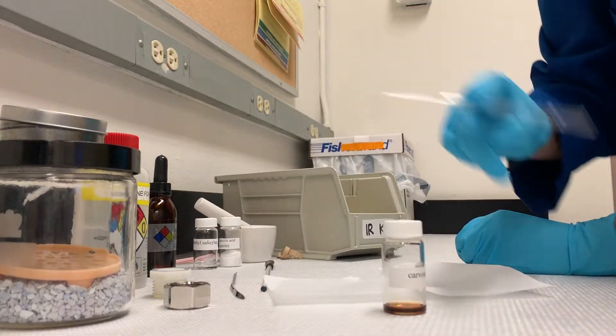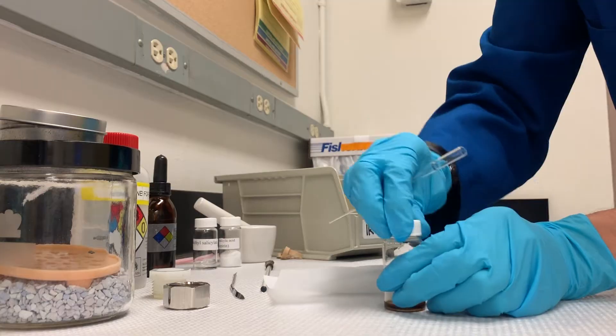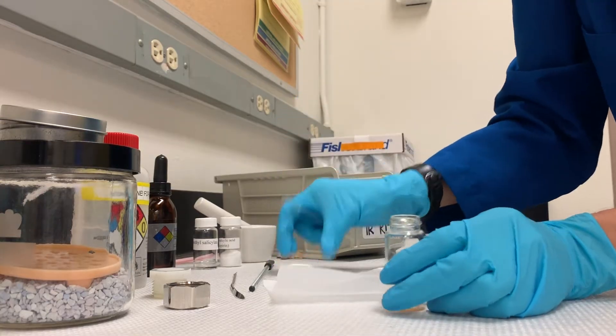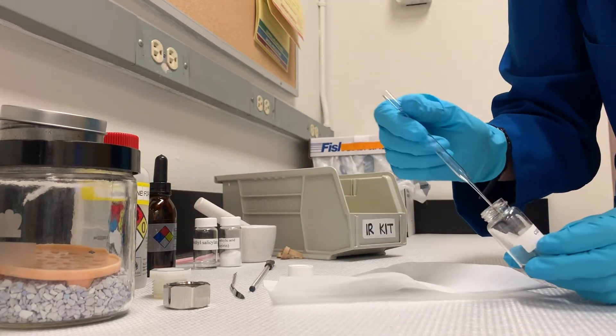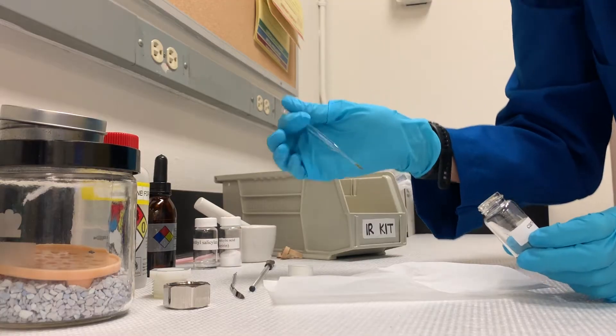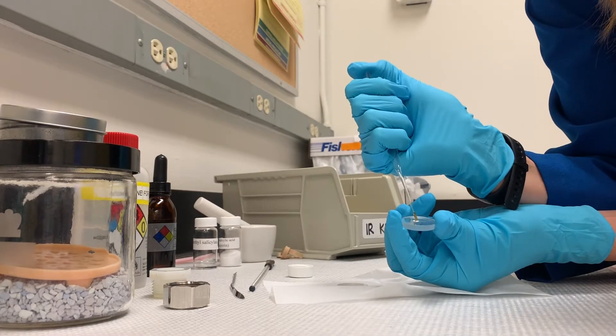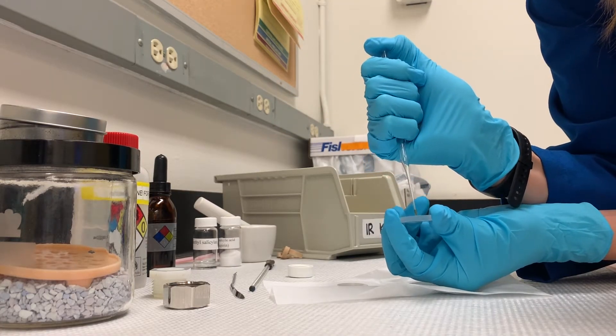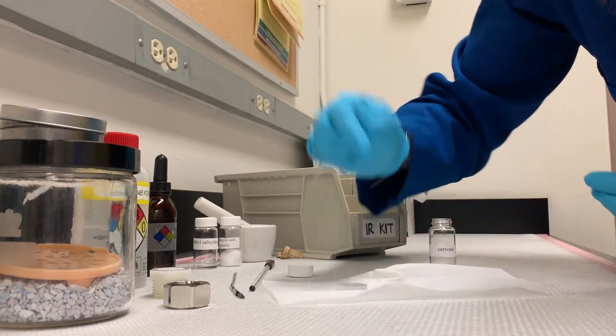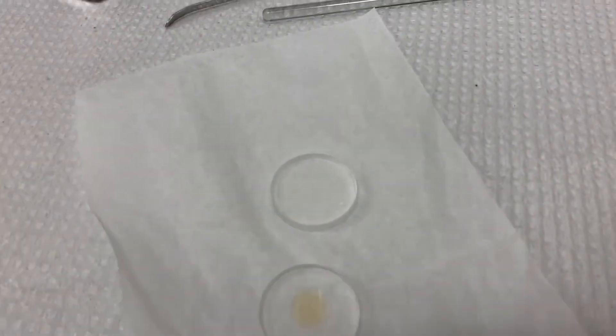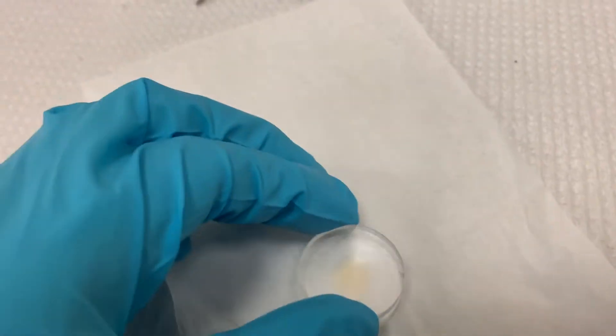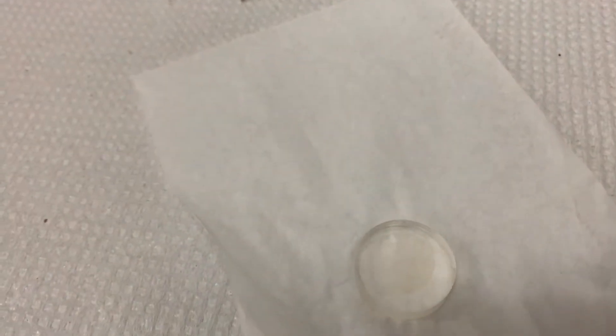All we need is a short stem pipette. Open this up, dip it in, so we get some liquid on there. Now you just depress here, get one little baby drop, set that back down. We have a little drop, simply add the second one here, get them back together.